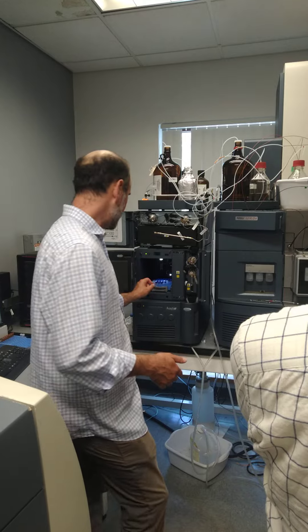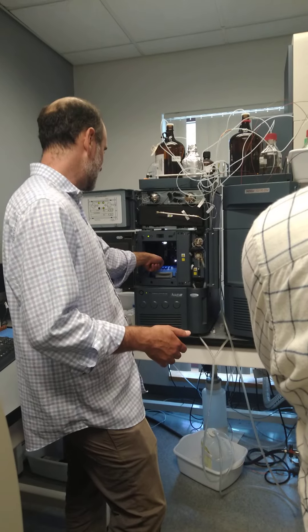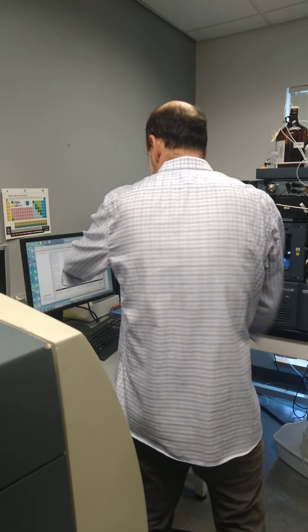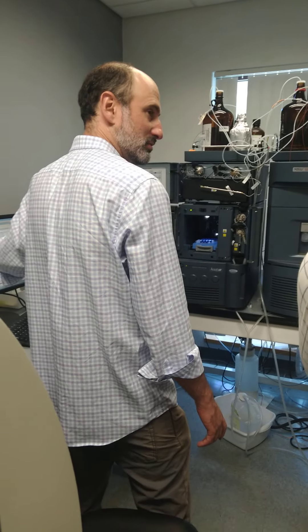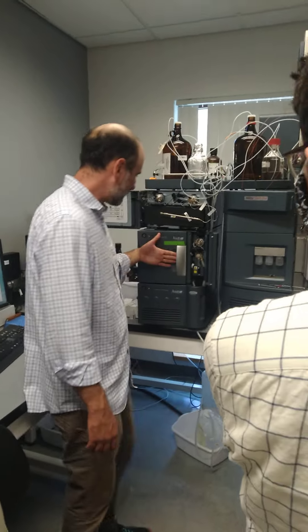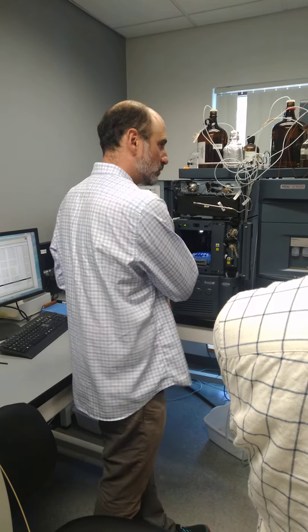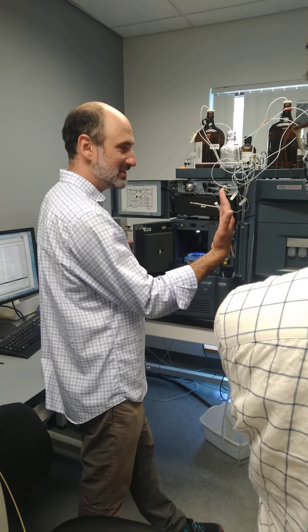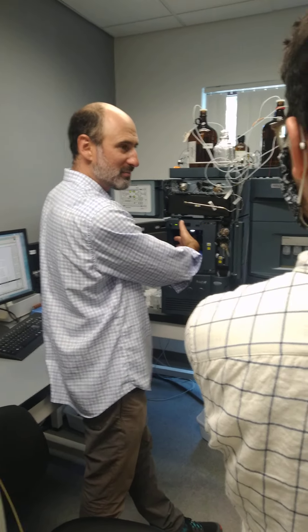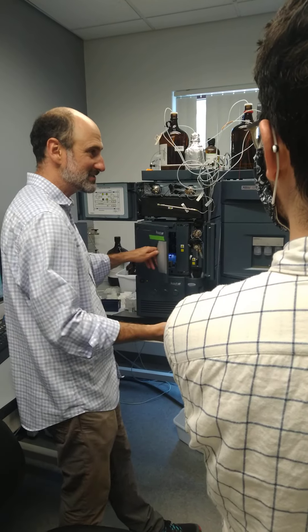Just reach in there and put your sample in position. This auto-sampler is set up A through F, one through eight, so your position here would be plate one, A1. If you forget the way it's set up, you can follow along with what the software tells you. When you open the sample manager door and it opens front-back like this, you can load samples. But if the instrument is working and you catch it right when it's using the needle, it'll open up at a 45-degree angle. If you don't see it open straight back, the needle is probably doing something — just close the door, wait 30 seconds, and it will be done.